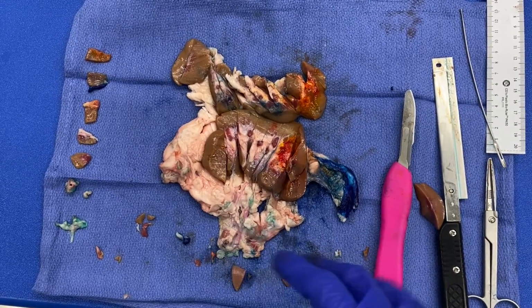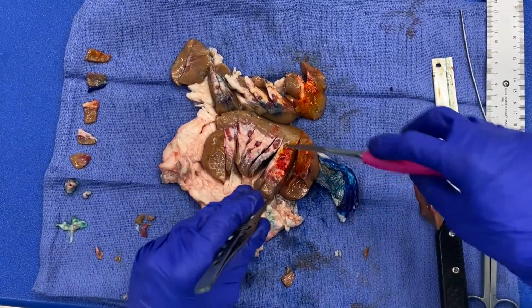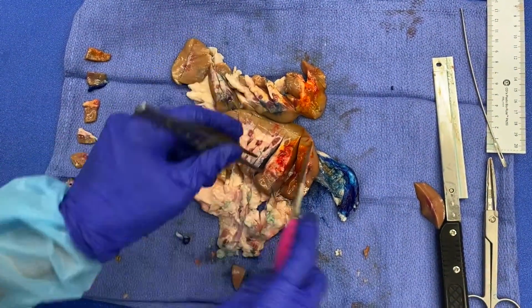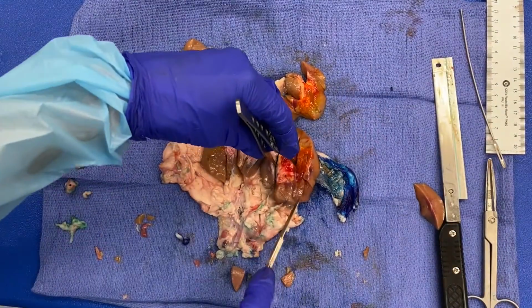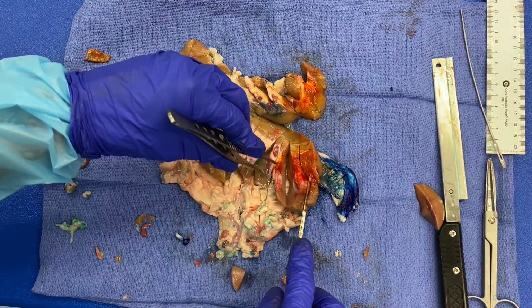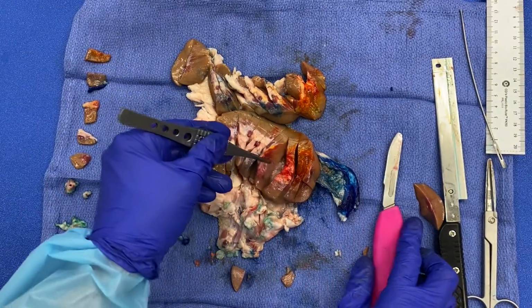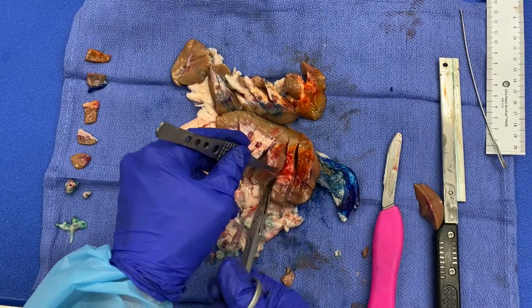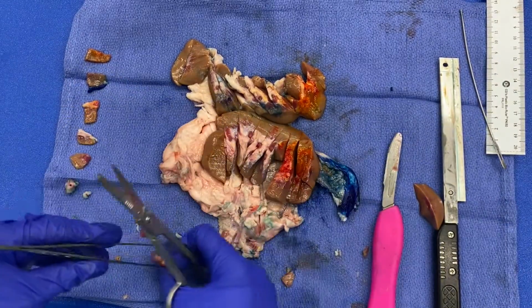And again, get variegated areas of the tumor. I would probably sample again over here. I left this a little intact so that I could also get that angle of the tumor in relationship to that renal pelvis. So can even take a straight section actually. And this one I'll probably have to trim on the bench instead of as I cut it. As you can see, it's pretty thick.